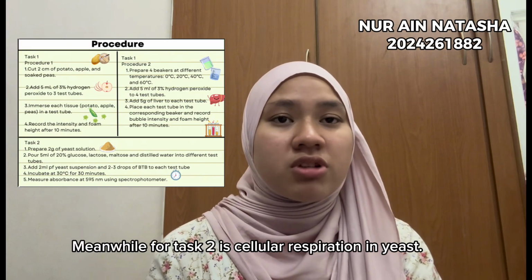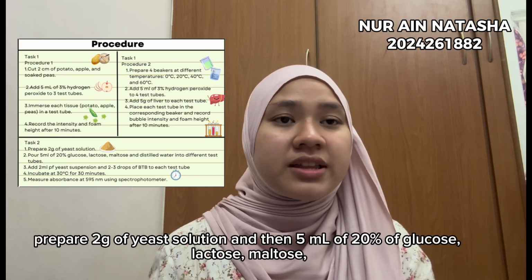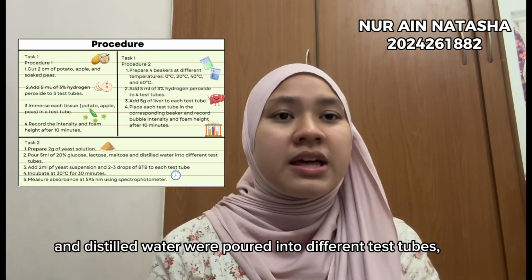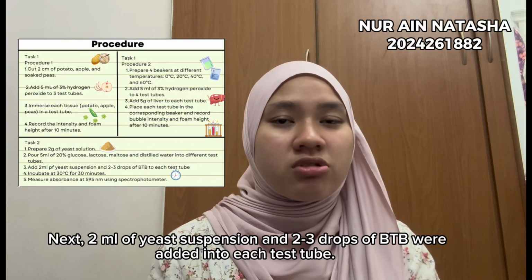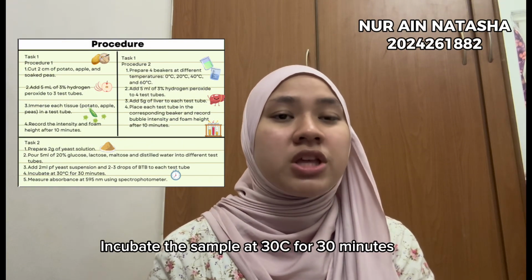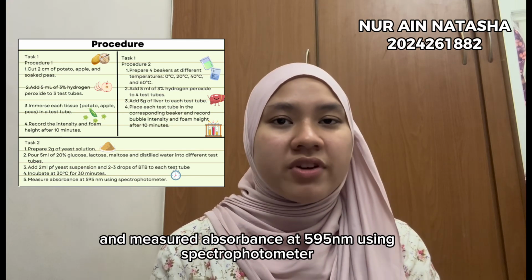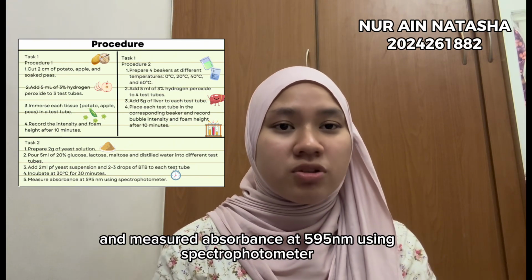Meanwhile, task 2 is cellular respiration in yeast. Prepare 2 grams of yeast solution and then 5 ml of 20% of glucose, lactose, maltose and distilled water were poured into different test tubes. Next, 2 ml of yeast suspension and 2 to 3 drops of BTB were added into each test tube. Incubate the sample at 30 degrees Celsius for 30 minutes and measure the absorbance at 595 nanometer using spectrophotometer.